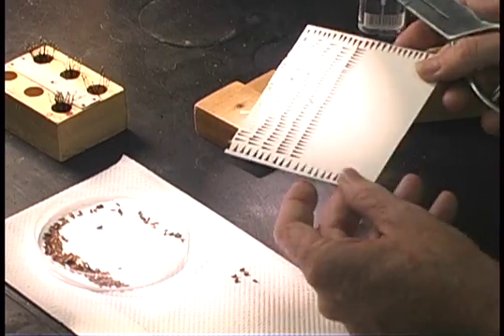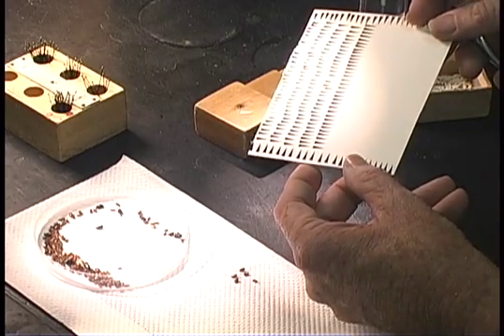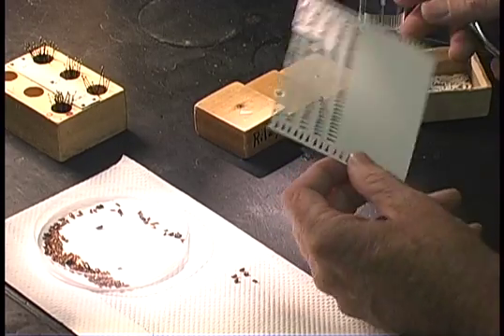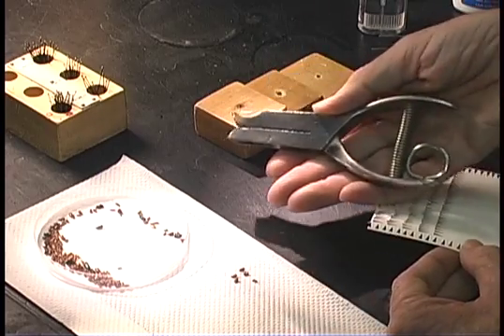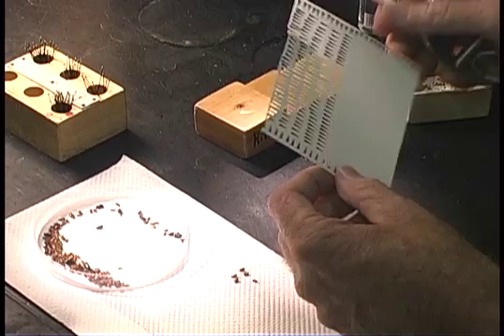First thing you need is some good paper. We use an archival quality two-ply Bristol board. This paper is guaranteed to last a long time, and a commercially available point punch designed specifically for punching insect points.